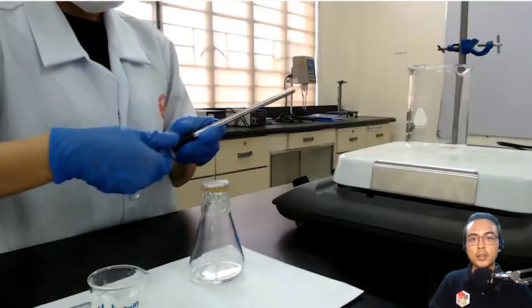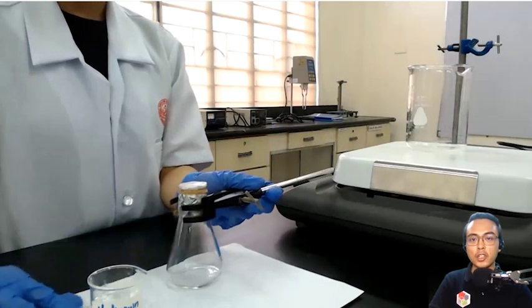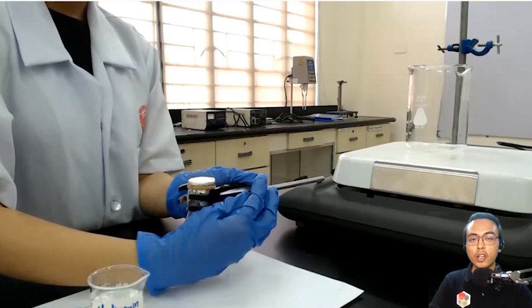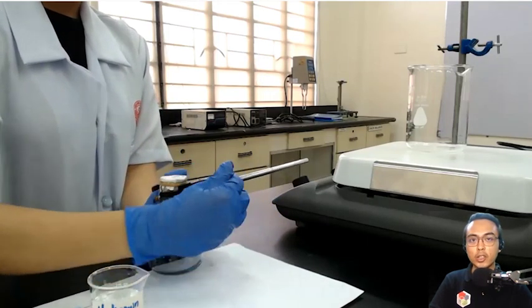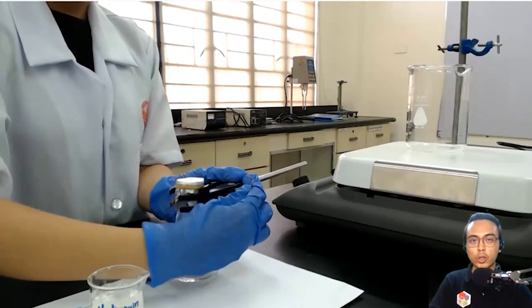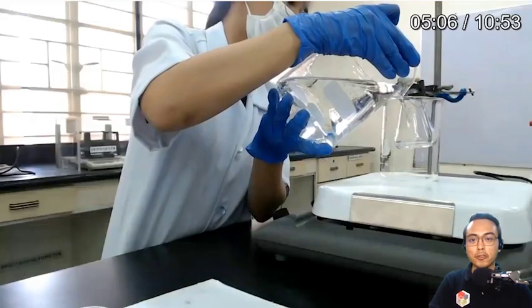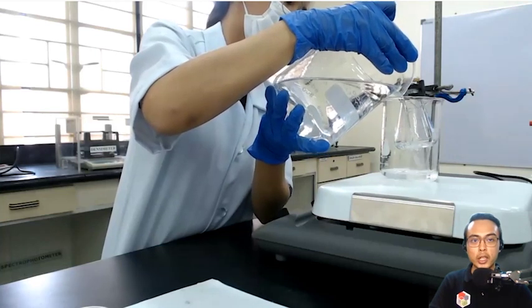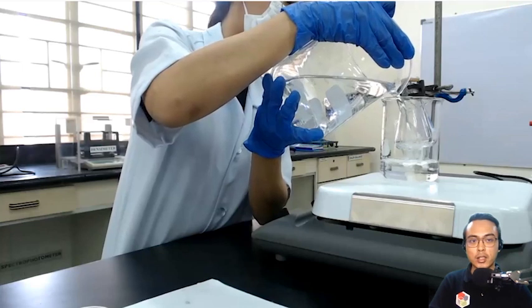Okay, and then afterwards, we are now ready to place the clamp on the neck of the Erlenmeyer flask. The clamp allows us to suspend your Erlenmeyer flask into a boiling water bath. Basically, what we are trying to do is we want the flask to reach the temperature of the boiling water, and that would allow the unknown liquid to vaporize. After attaching the flask, you see that we are now boiling water in a beaker to which we are suspending our Erlenmeyer flask.